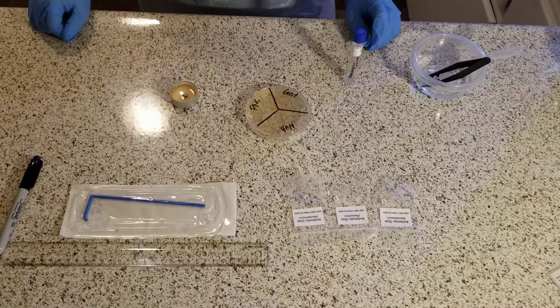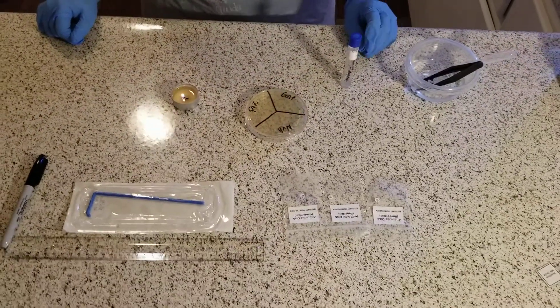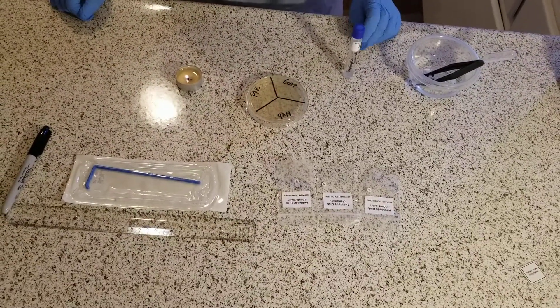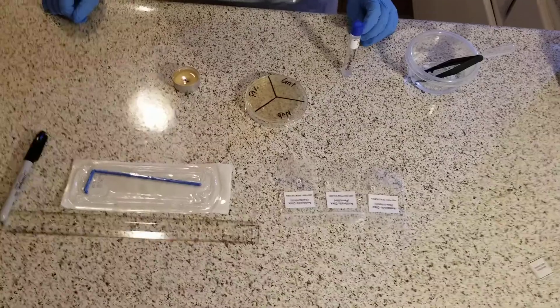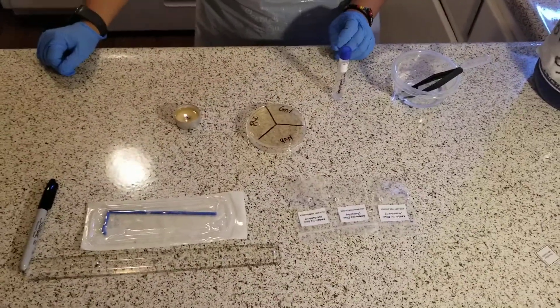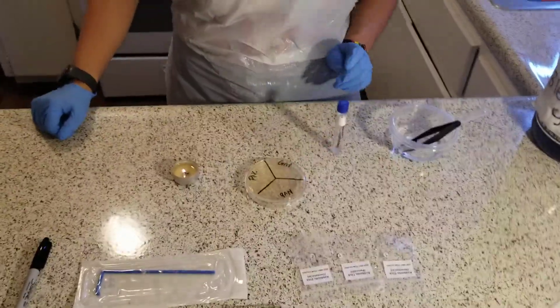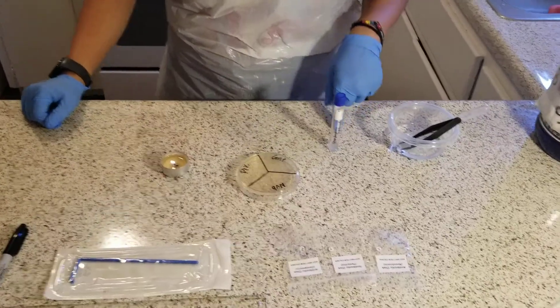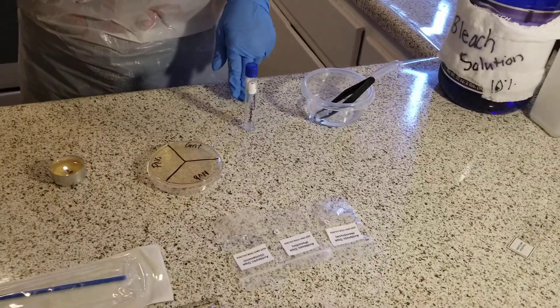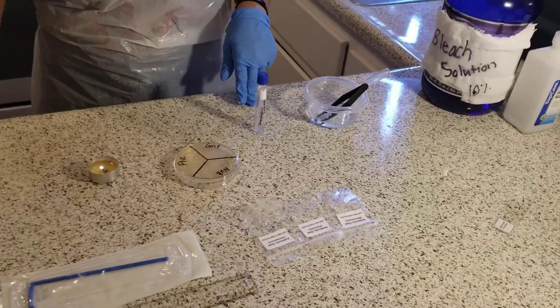The experiment today is called Antibiotic Sensitivity Kirby-Bauer Diffusion Test. In this exercise, I will be performing a Kirby-Bauer Diffusion Test with Staphylococcus epidermidis and three antibiotics: penicillin, novobiocin, and gentamicin.